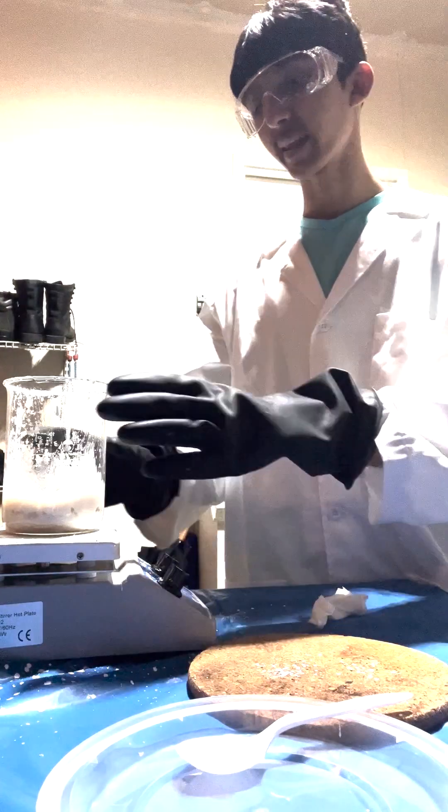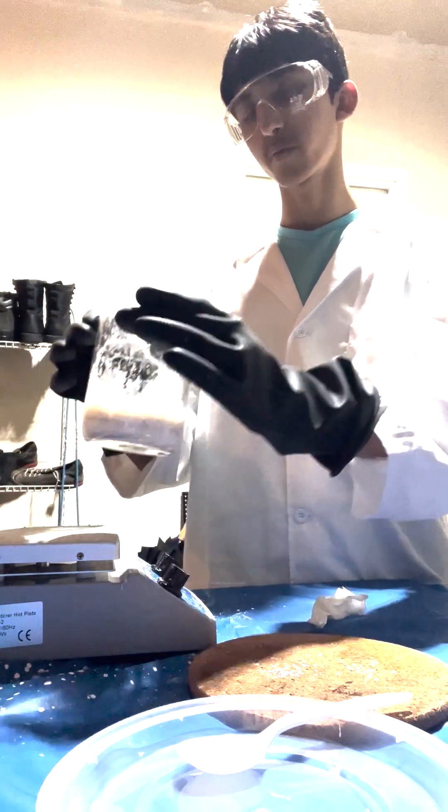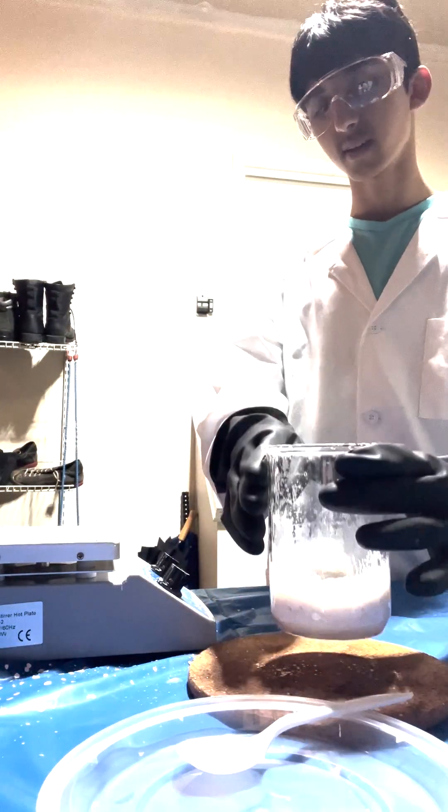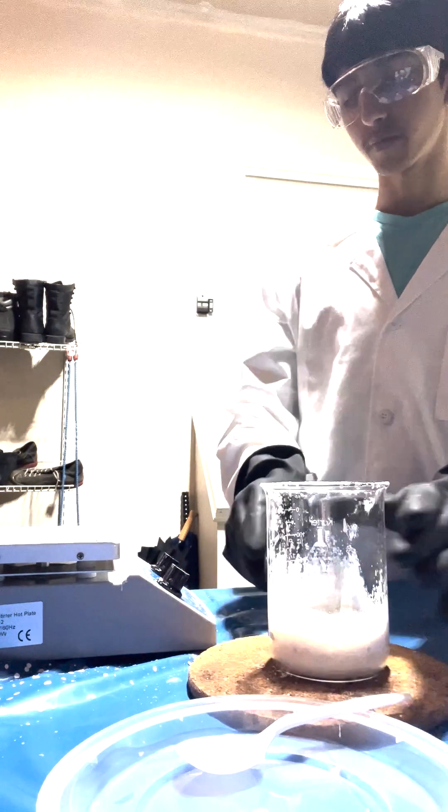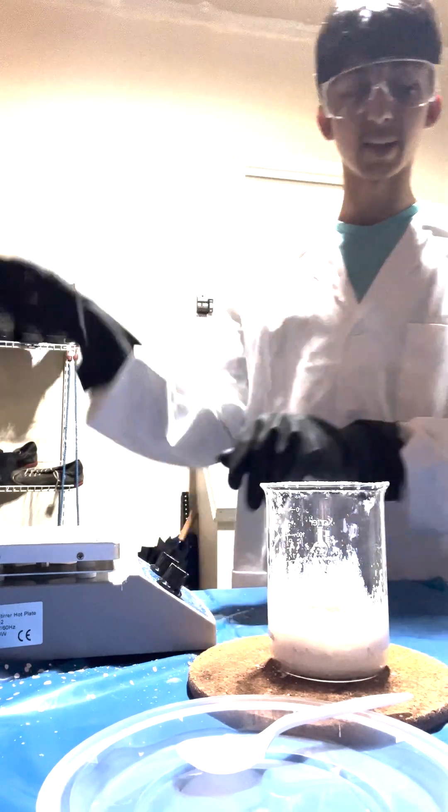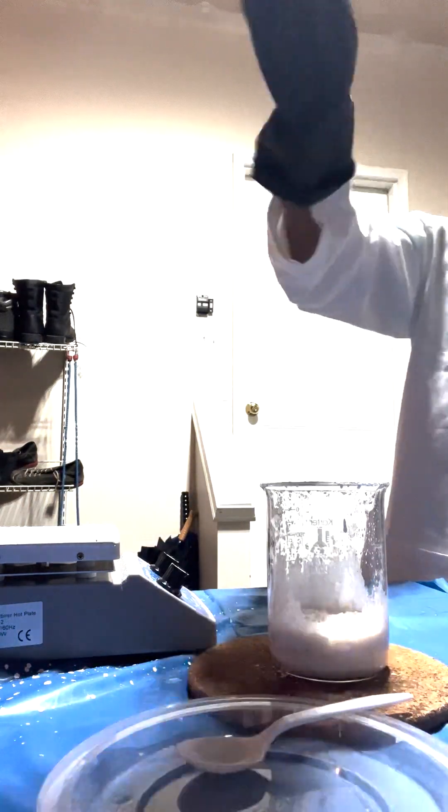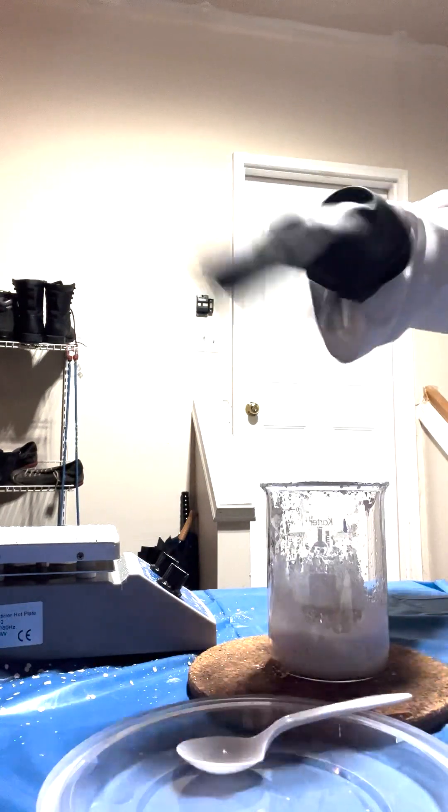Finally! It's been like two hours of boiling, and I think we're finally ready to take it off the hot plate. The bottom's a little bit burnt, that's just the impurities though. But as for the calcium acetate itself, we just let it cool now, a little bit, then we put it onto our dish, dry it, and crush it.